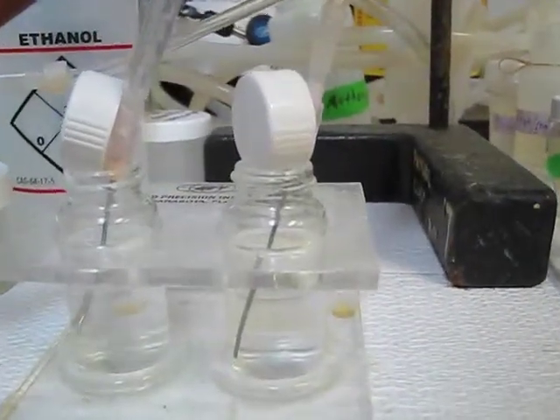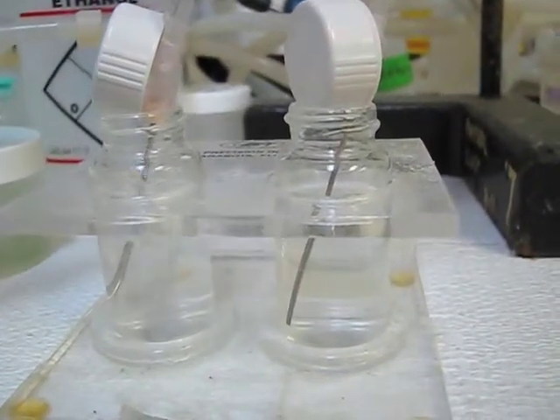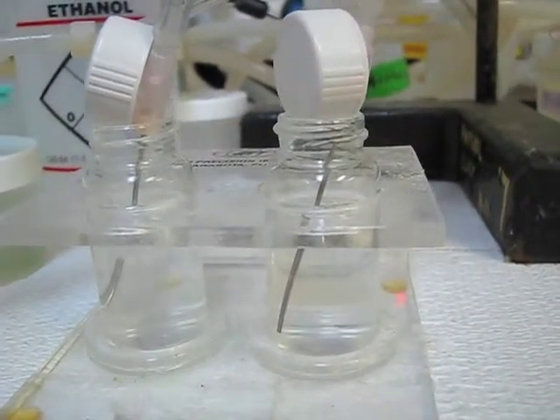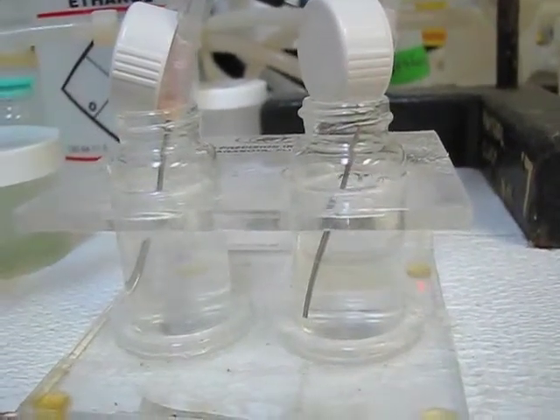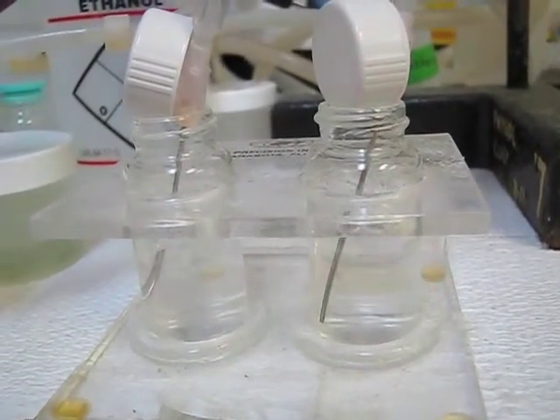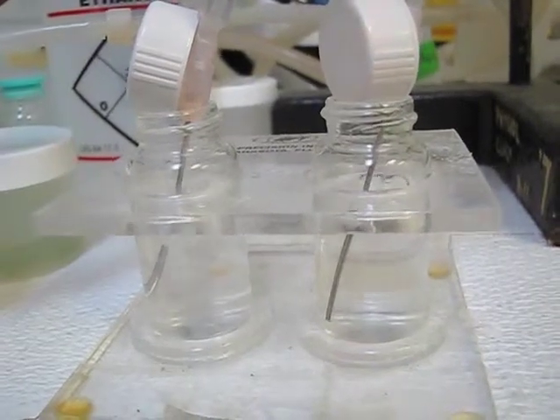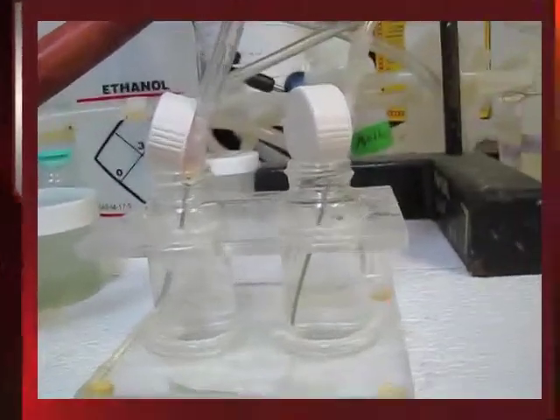I'm going to turn on the nitrogen first. A medium flow rate will be suitable, because we have a small enough volume that we don't need to bleed this for hours on end. Now I'm turning oxygen on. I want a steady flow rate so that we can get it saturated after about 2 minutes — that should be suitable. We will let that go for about 10 to 15 minutes, and then we'll pick up and start the actual calibration of the sensor.